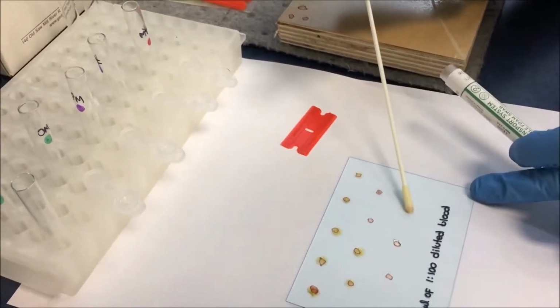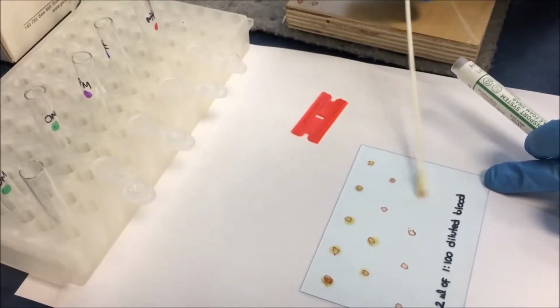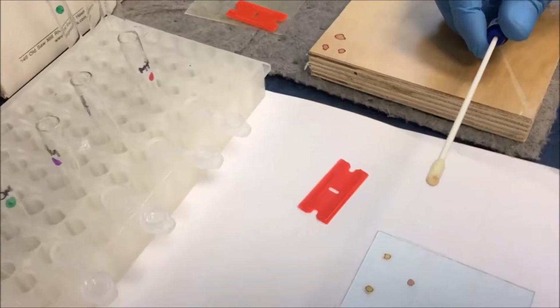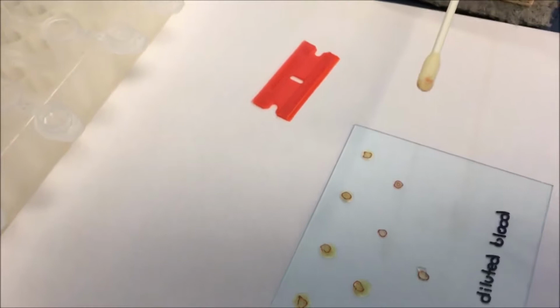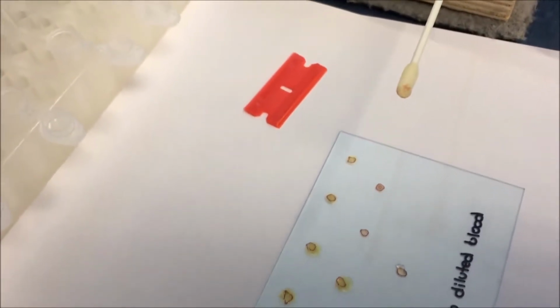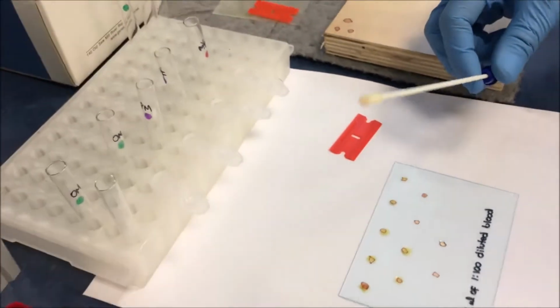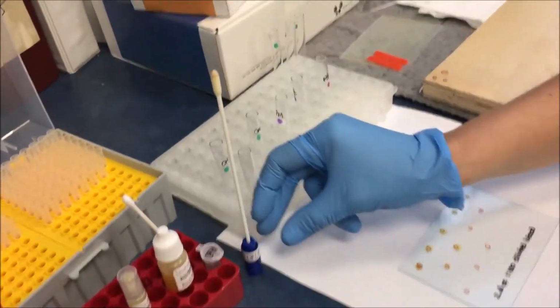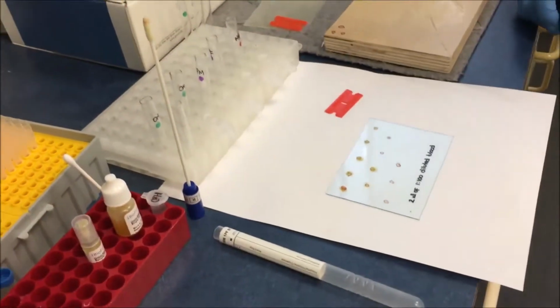Usually if the sample is in trace amount, you won't be able to see any leftovers. Most of the sample is collected on the swab itself, and there's hardly any left there. But usually about 15 to 30% of the sample is actually left there because it was unable to be swabbed. After the sample collection, it is allowed to dry on a benchtop or in the supplied container. This is the supplied container, and this is transported.